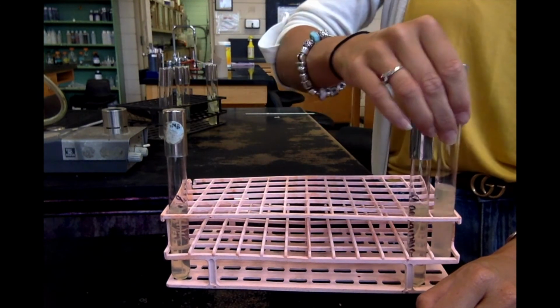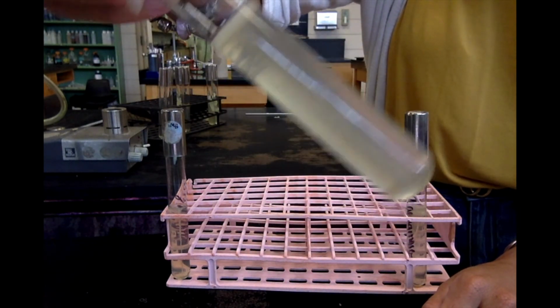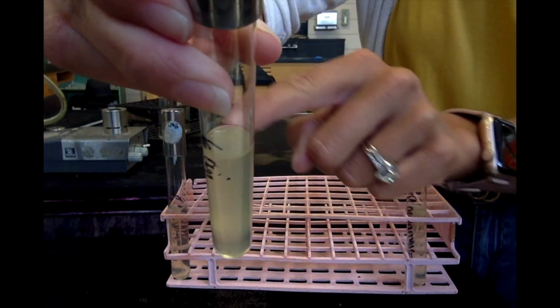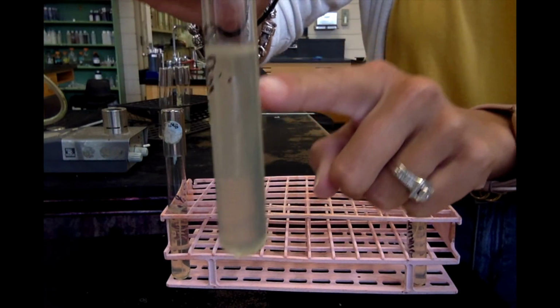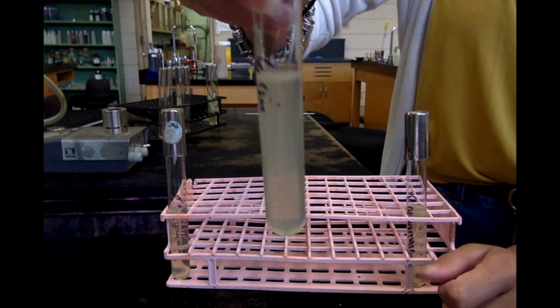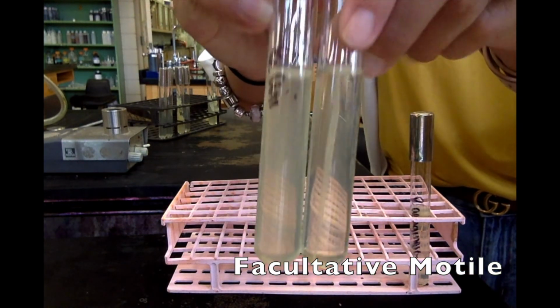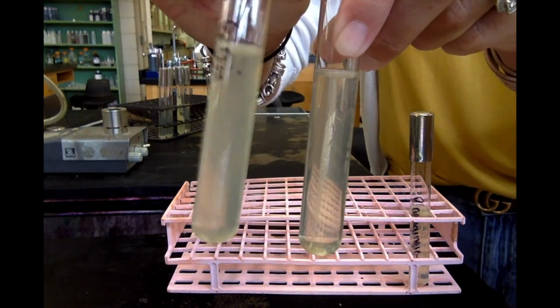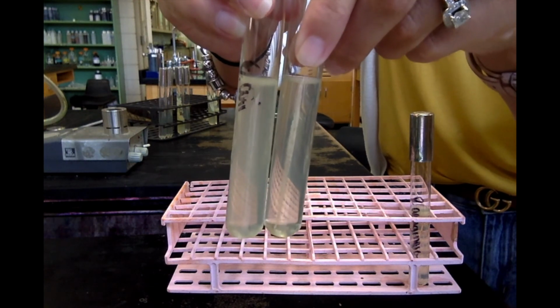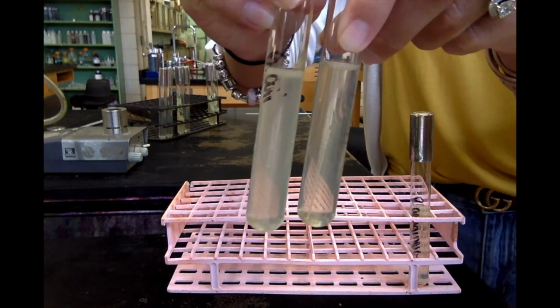The next, E. coli. You'll notice that the whole tube is cloudy. Okay? And the top, you see the top there is completely covered in white. It grew at the top where there's oxygen, at the bottom where there's no oxygen, and it moved away from the stab line. So E. coli is a facultative motile organism. Look at the difference. This is non-motile, this is motile. Do you see how cloudy this is? Okay, so both of these organisms are facultative, but staph does not have the ability to move. E. coli does. E. coli has a flagella.